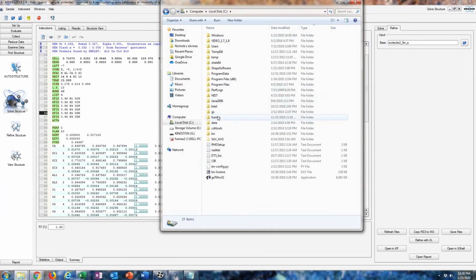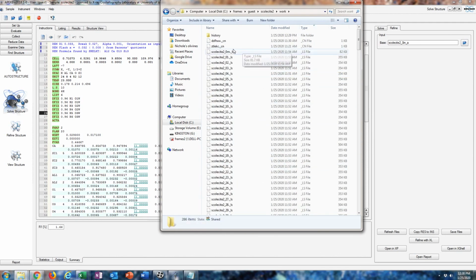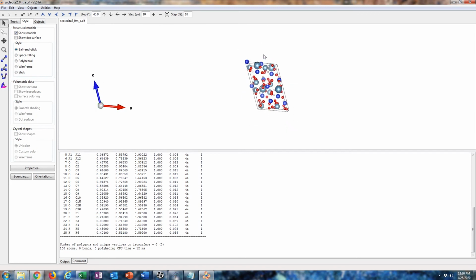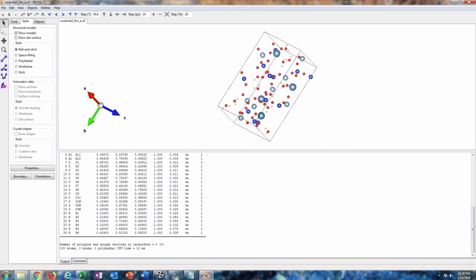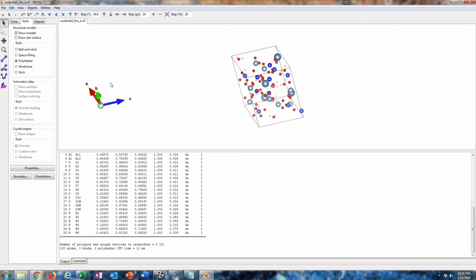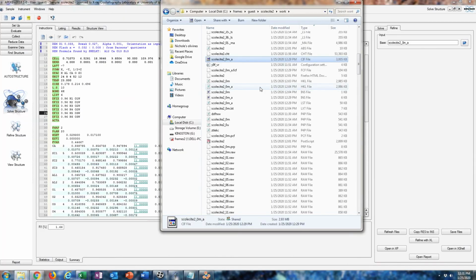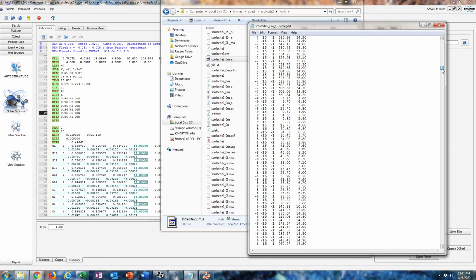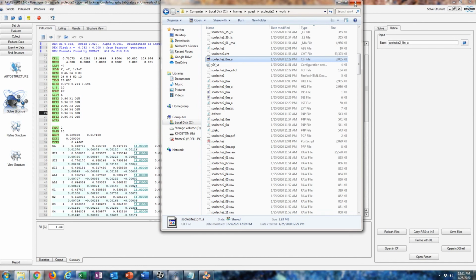And then you can view the structure in whatever structure viewer you have. There are free ones like VESTA to plot it. And that's what our structure looks like. I don't know how to use VESTA very well. I'll try to do a polyhedral model. Yep, that did nothing. Oh, I probably needed to connect. Yeah, I probably needed to do another command. But anyway, there's our CIF file.